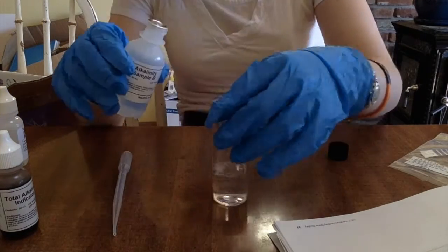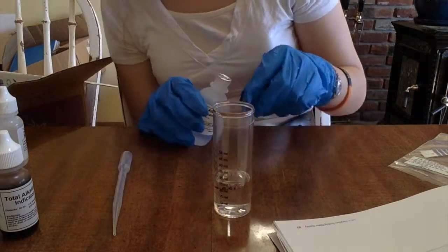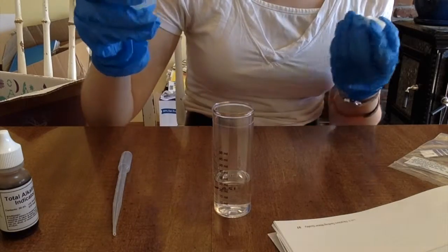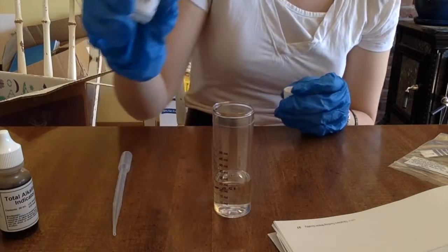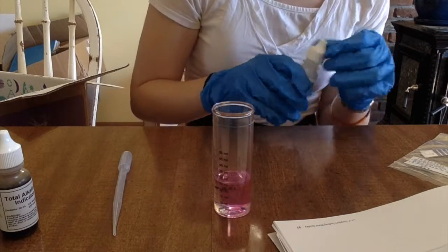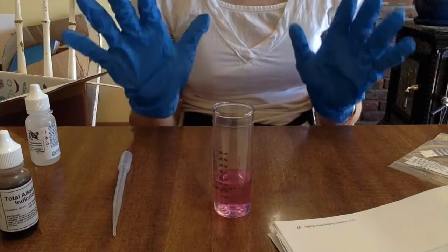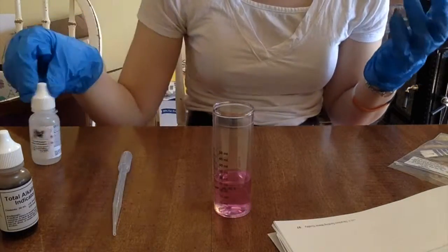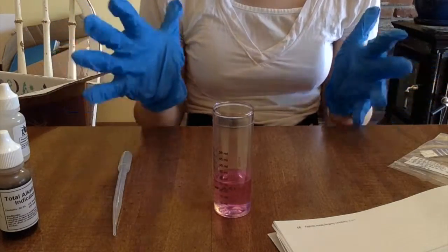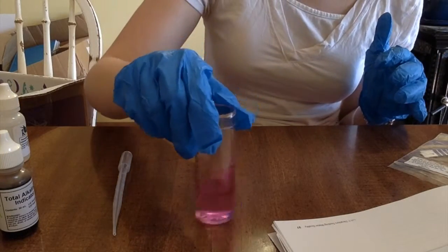That got a lot faster than last time — just perfect. So first step is the P indicator, three drops of it. More drops may be necessary, we just need a pink color. One drop — whoa! Okay, that's the color they were looking for last time. That was like one drop. Wow, golly, that's a bright color! I'm pretty sure that's the pinkish-red color.